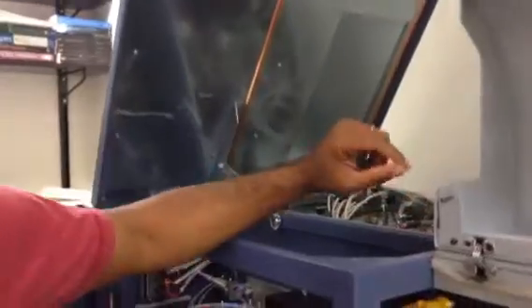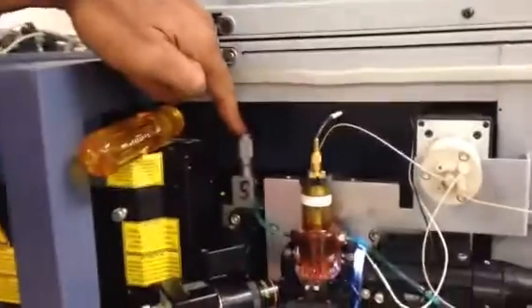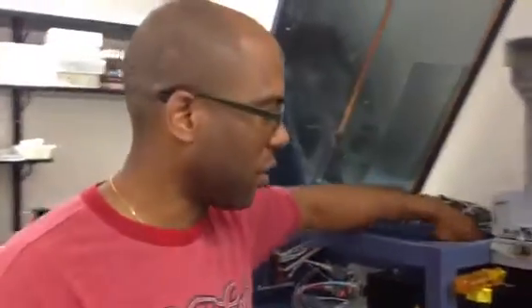So what I was showing earlier was we have the 3 micrometer adjustments, which look like this one here. There's one at the front, and we have 2 more inside of the machine, which might be difficult to see with this lighting. But they all represent adjustment for the sweep of the laser up and down, left and right, or the depth of the laser focus.